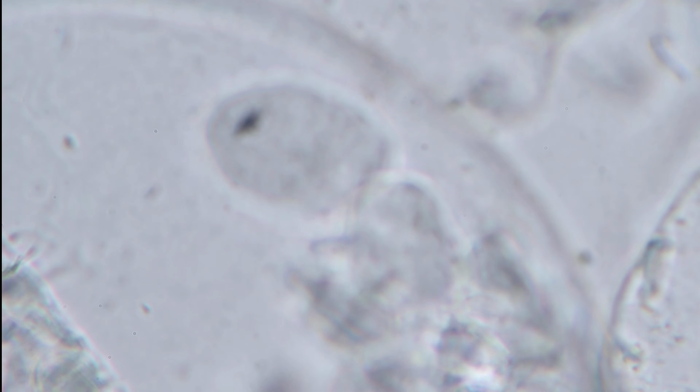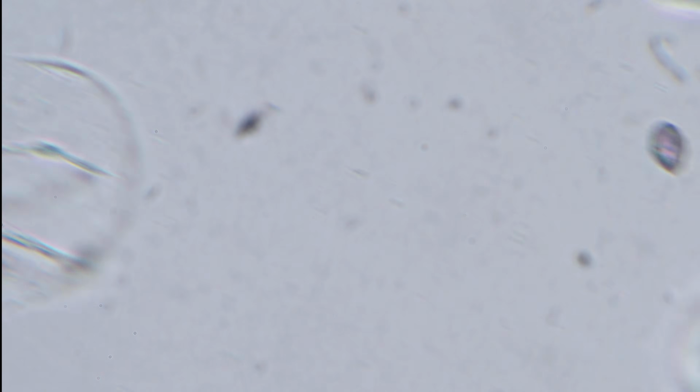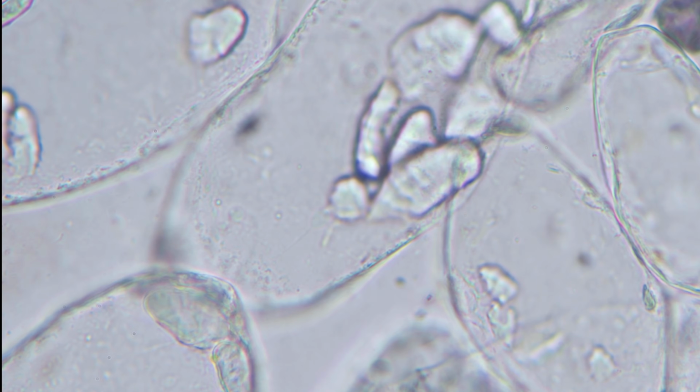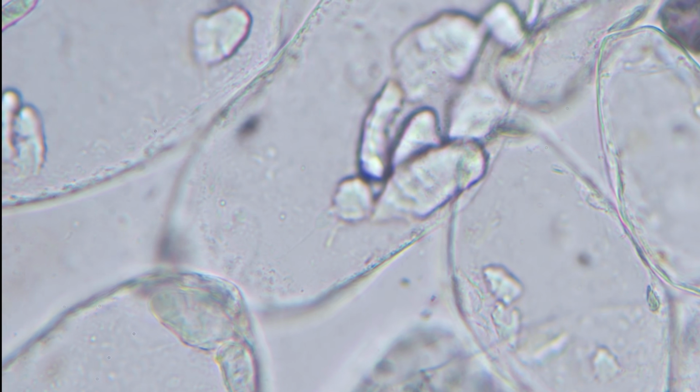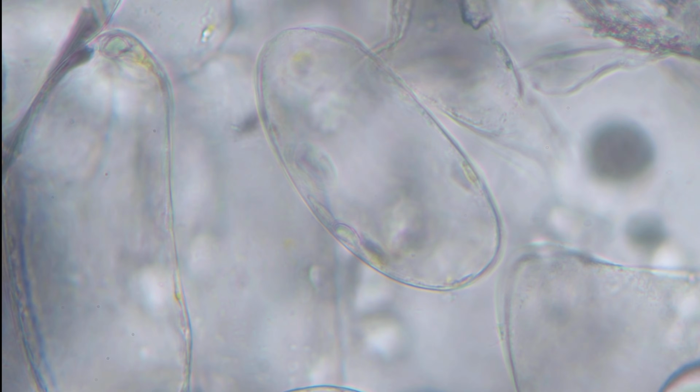Just focus, yeah. Whatever you're seeing here are things that are very normal in fruits and other foods. And trust me, like I said, I've looked at so many specimens under a microscope, so I can tell when something is out of the ordinary. So nothing. Go to the next banana.